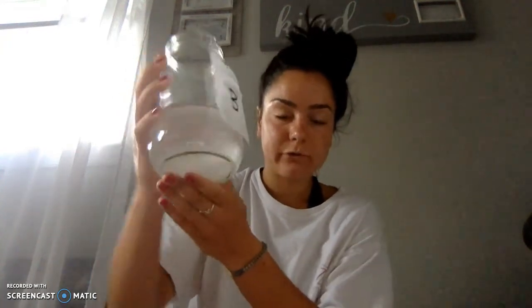For solution B — here is my solution B — it's a little cloudier than it is supposed to be, but it's pretty close. I added about 0.4 grams of cornstarch, 150 milliliters of the hydrogen peroxide, and distilled water. It was a lot cloudier initially, so I heated it in the microwave until it boiled so I could filter it out. It's still a little cloudy, but a lot clearer than it was initially.